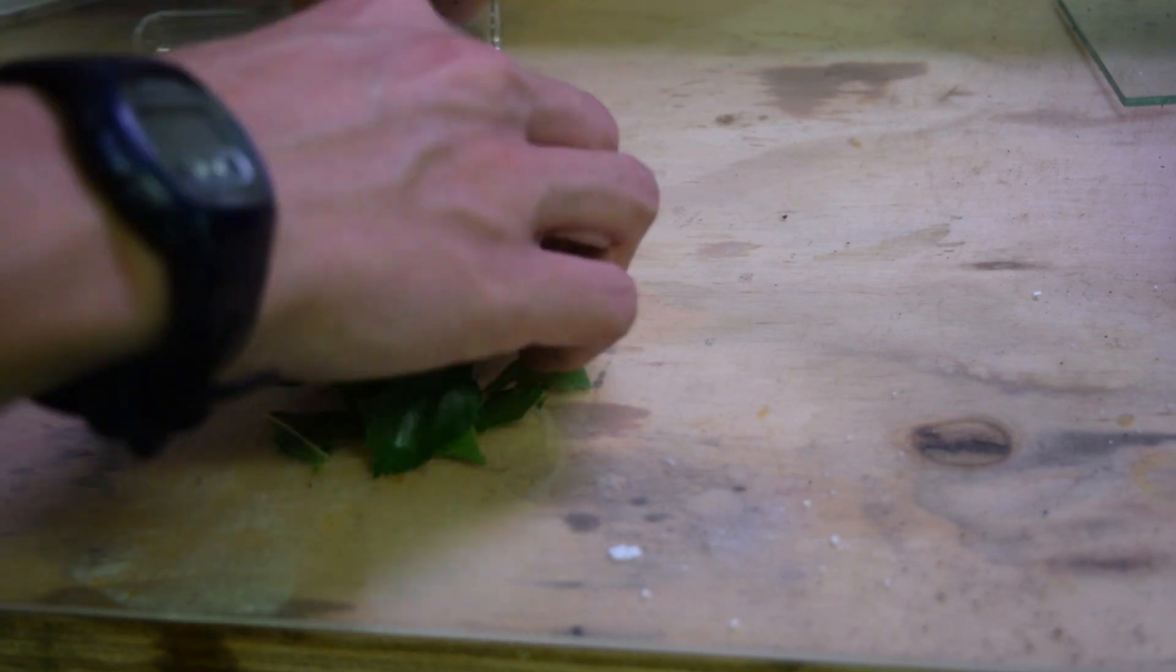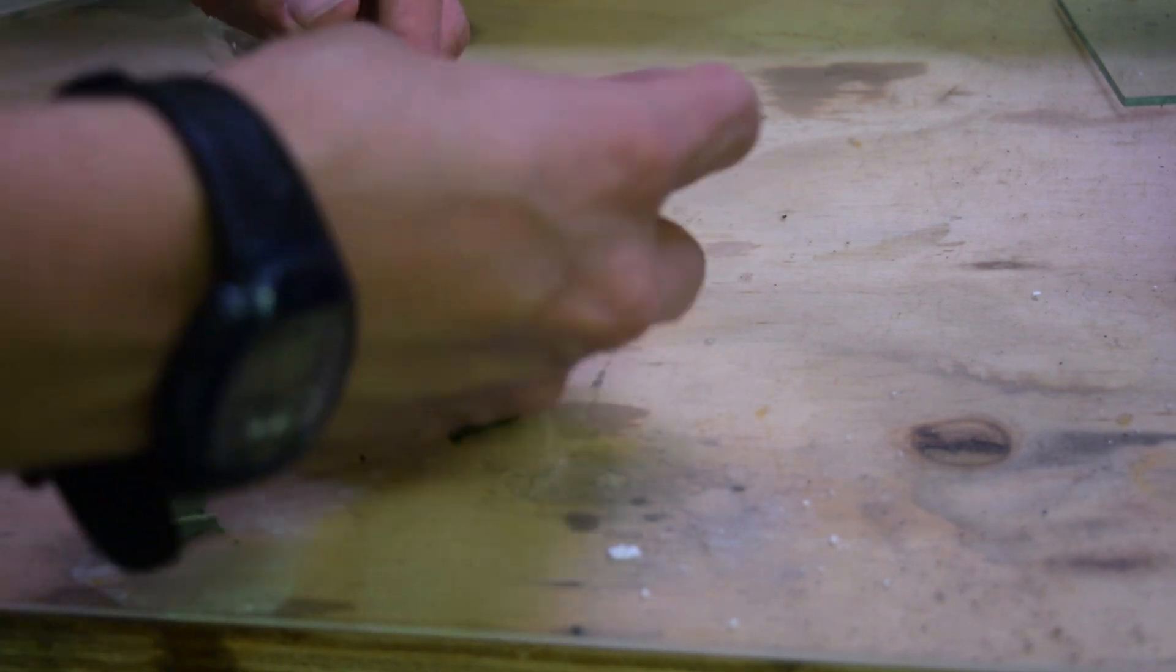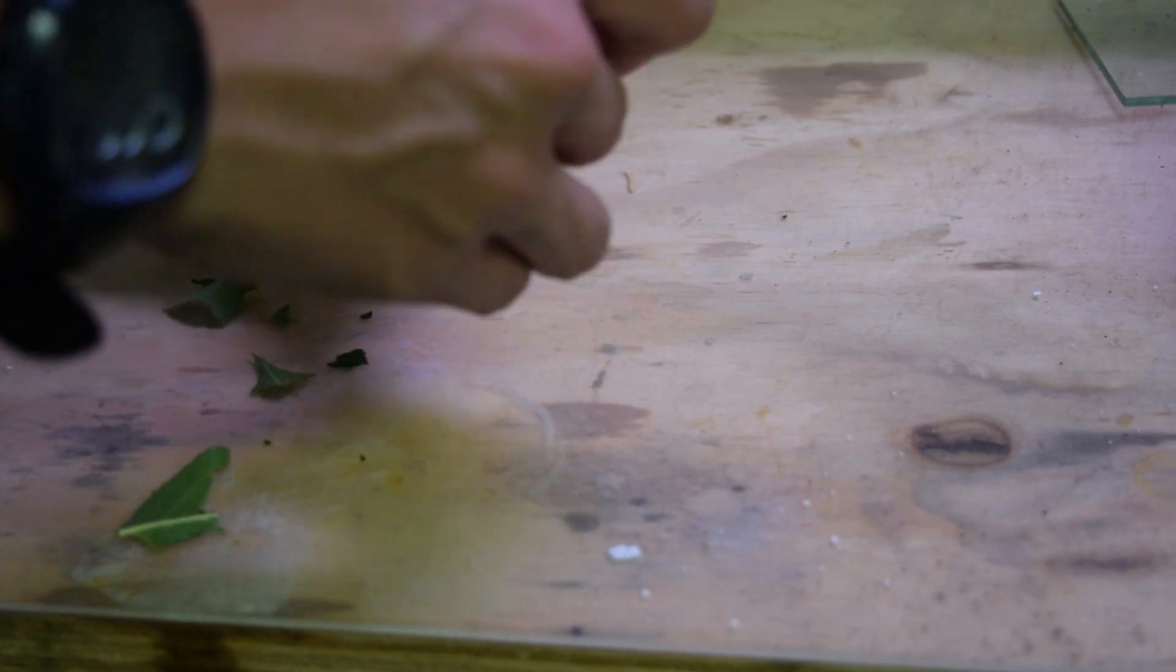Hey guys, this is GoofreKing and today we're going to be extracting chlorophyll from leaves and exploring its fluorescence under a UV light.